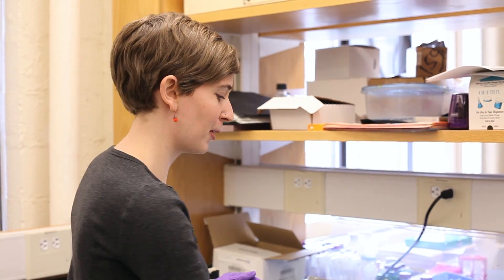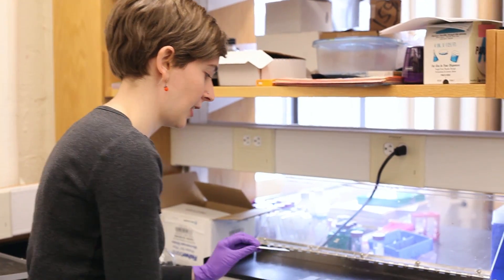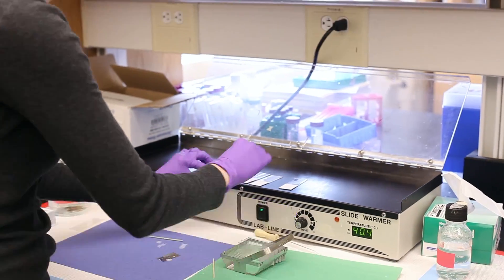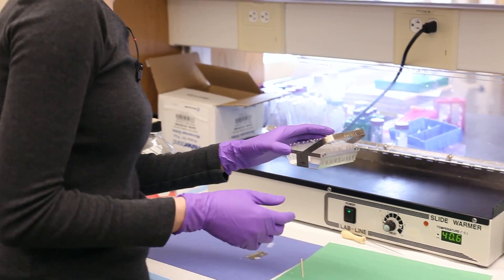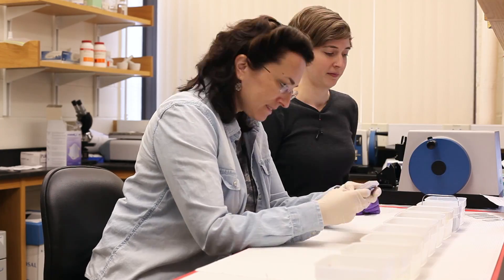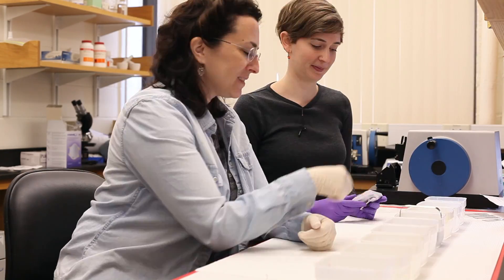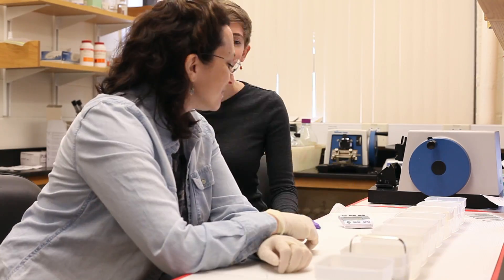Now that the slides are dry, I'm going to put them in this little slide rack for the next steps. We have to get the tissue on the slides ready to reveal their gene expression. To do that, we have to soak them in a hilariously large number of solutions. These solutions will help dissolve some of the wax, get rid of any proteins, and generally help the experiment go smoother.